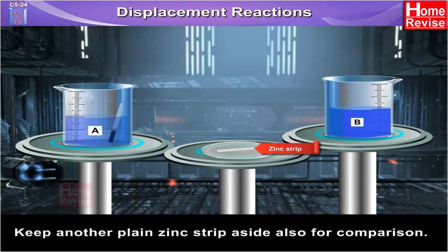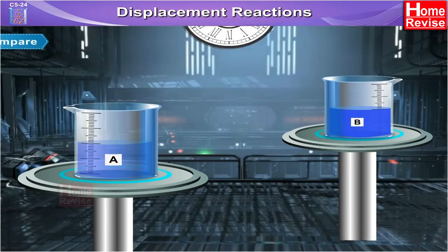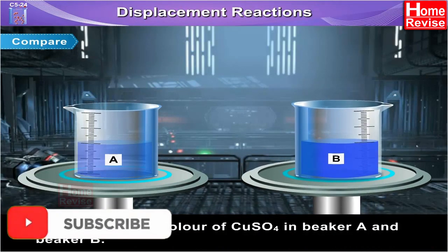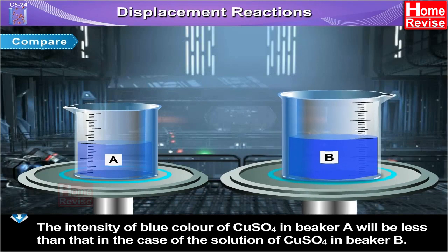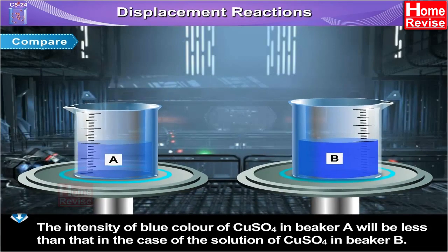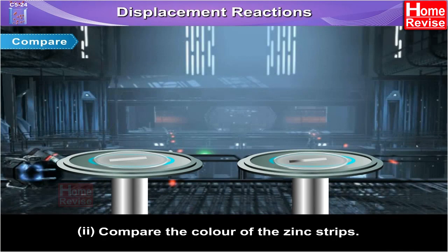Keep another plain zinc strip aside also for comparison. Remove the zinc strip after about five minutes. Compare first the intensity of blue color of CuSO4 in beaker A and beaker B. The intensity of blue color of CuSO4 in beaker A will be less than that in beaker B.